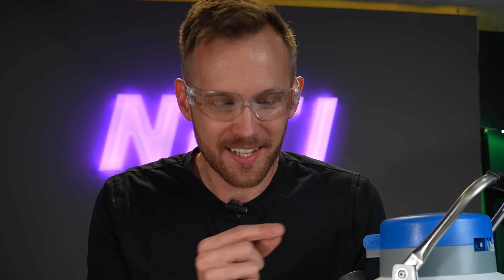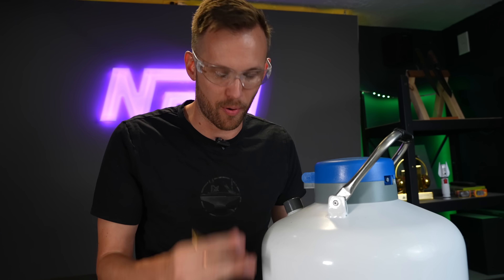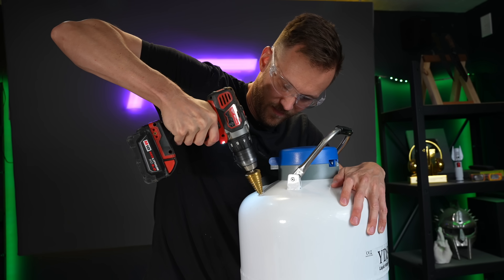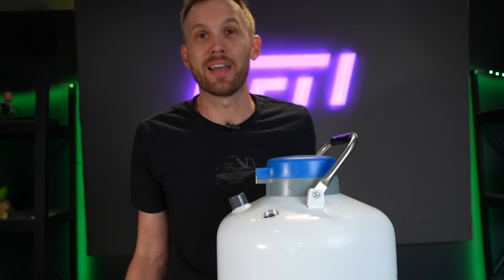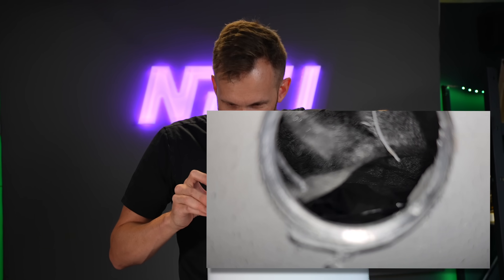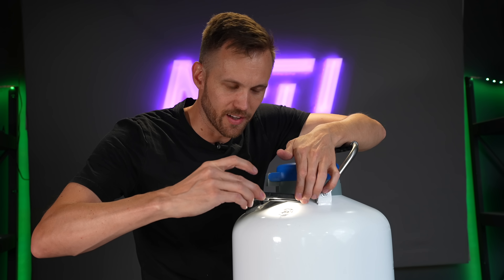Once it is completely depressurized, I'm going to use a step drill bit and drill a slightly larger hole to see if anything will pour out. My plan for cutting it the rest of the way in half is a bit more destructive. There is something in there — I can see a little coil of wire. I'm going to see if I can film down in there, but the phone camera shot is about as good as what I can see with my actual eyes. We are still in the dark, which means we need to really open it up.